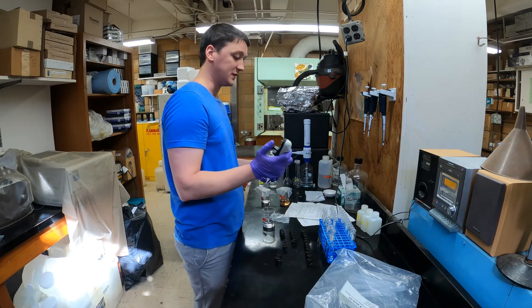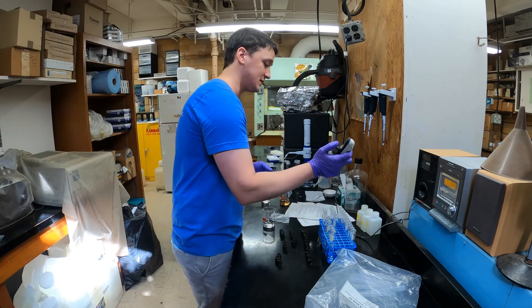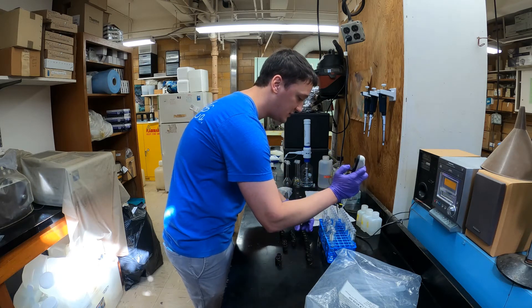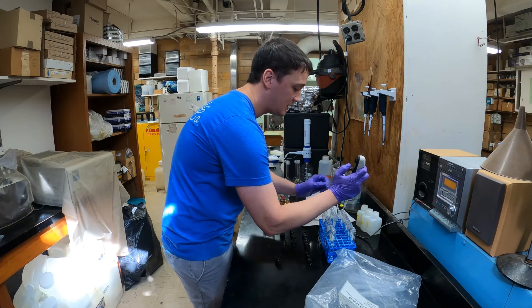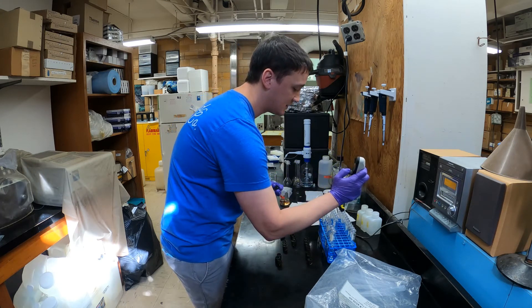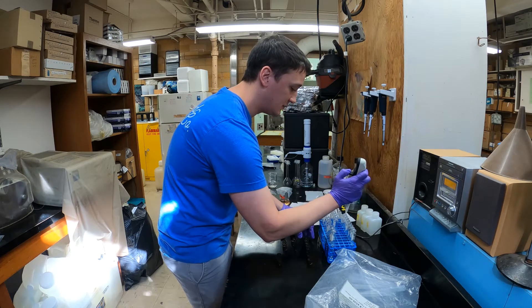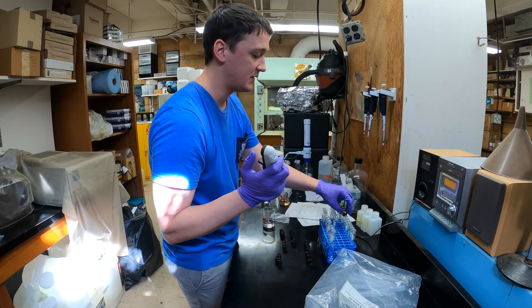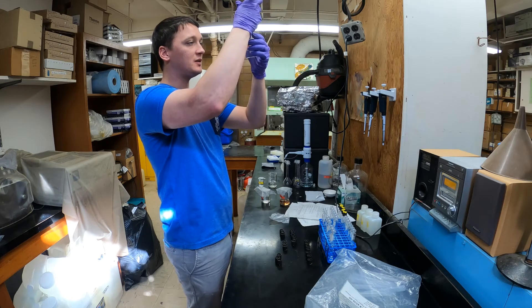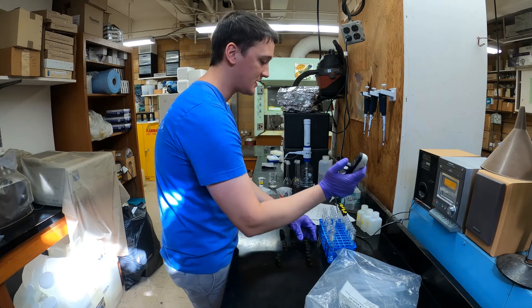When you come back to refill the tip it's really easy to forget where you were, so this is a trick I use to help keep track of everything. I'm being nice and consistent with the way I'm pushing down the pipette plunger, which helps keep all the tubes really consistent across the board. It does matter how much phenol you add, because it's actually what's reacting with the ammonium — if you add more phenol it tends to alter the reaction a little bit.